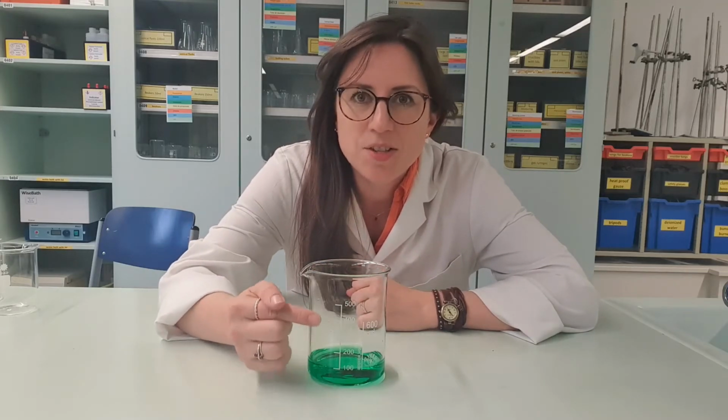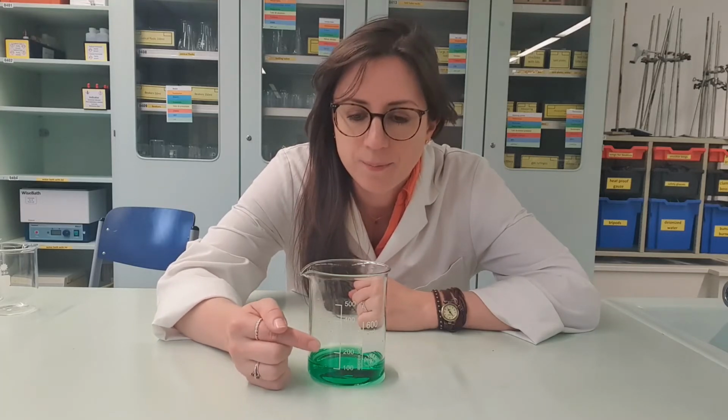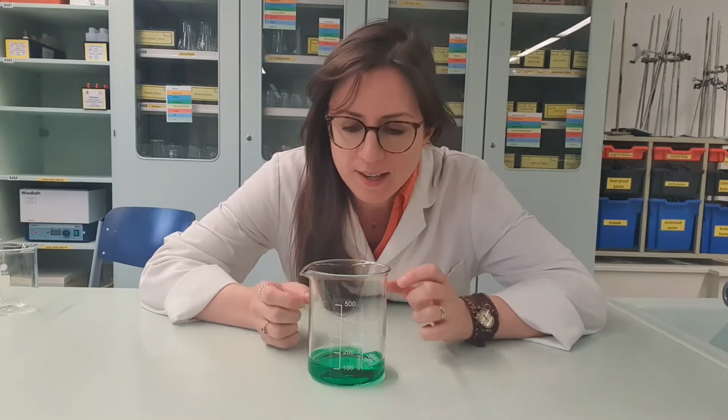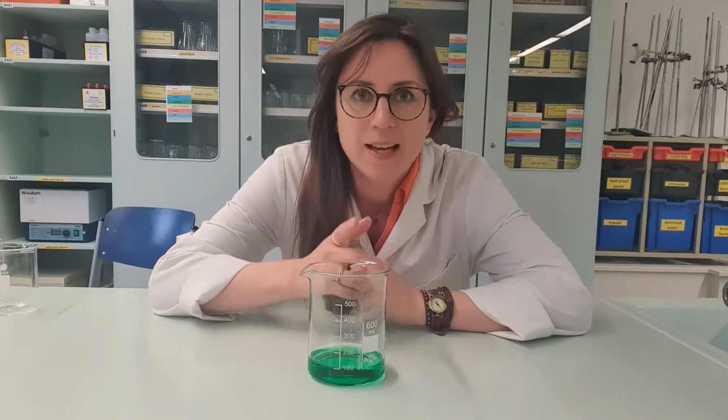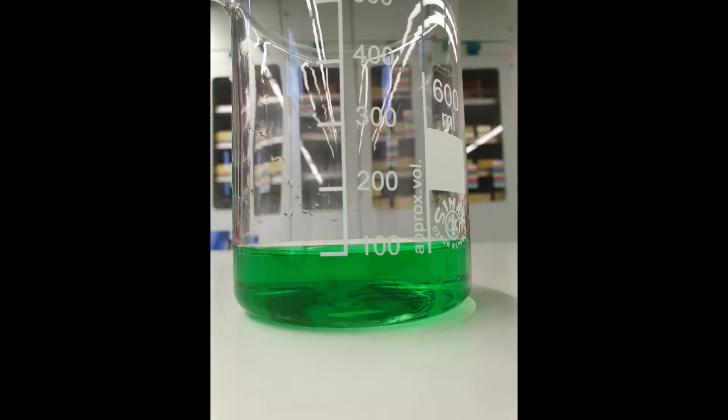This scale on the side is only an approximation of how much liquid is actually in there. So, according to this, there is 100 milliliters of this green water inside this beaker. Take a look. Bang on the 100 milliliter mark.